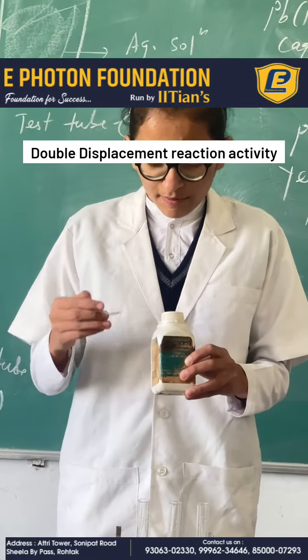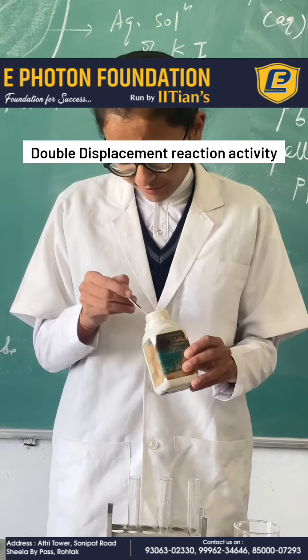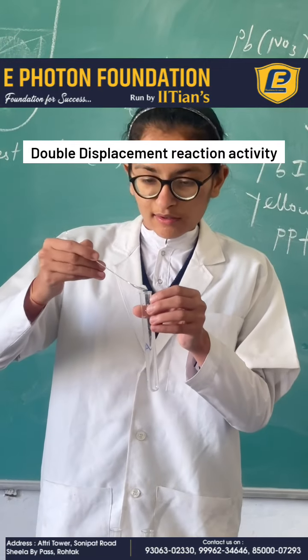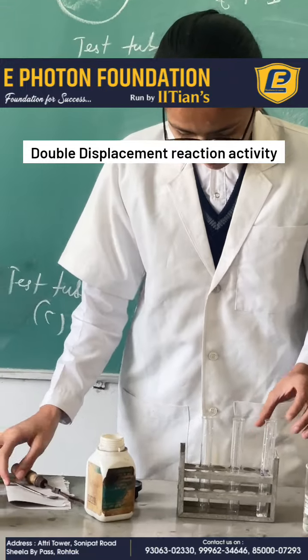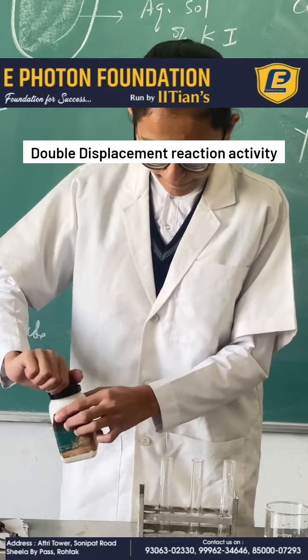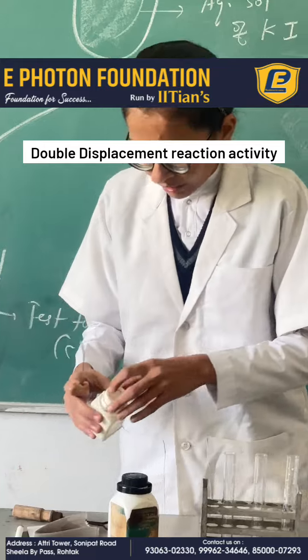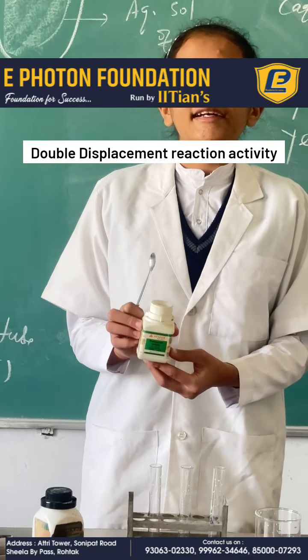Now take some amount of lead nitrate with the help of a spatula and add it into test tube A and close it. Now we take some amount of potassium iodide in test tube B.